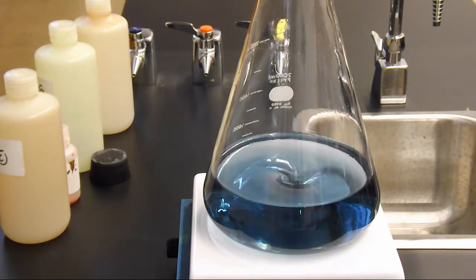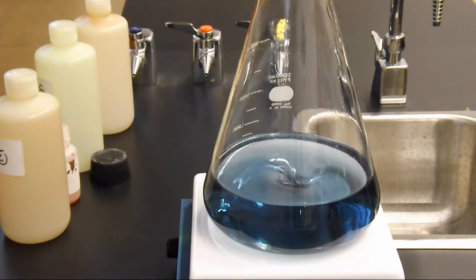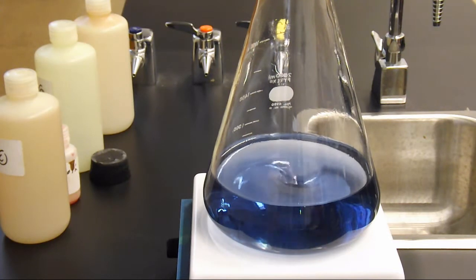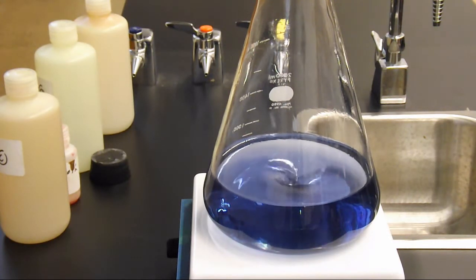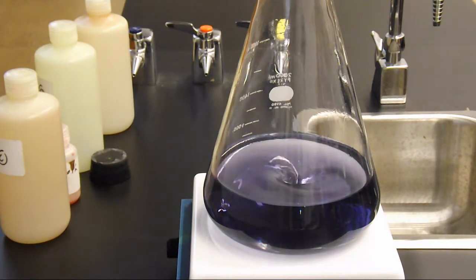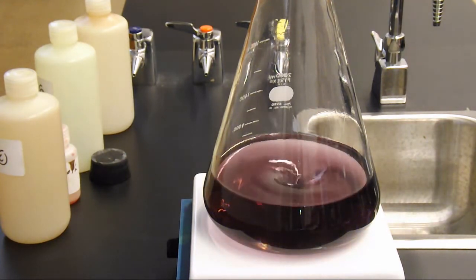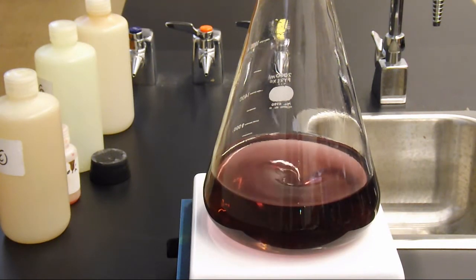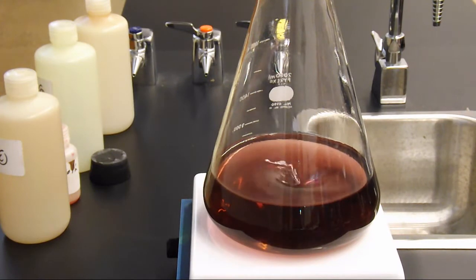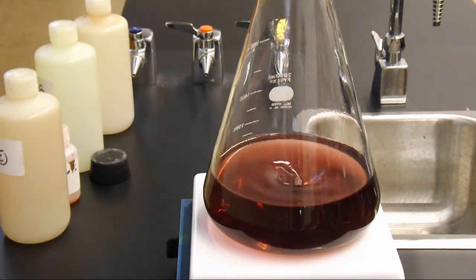The net result, though, is there is one chemical that's in fairly large excess. As that gets depleted, this reaction will end up stopping and go towards the final product. But given the rate that it's going, it's going to oscillate like this for easily the next 15 or 20 minutes — probably getting 40 or 50 oscillations as one reactant depletes in concentration.